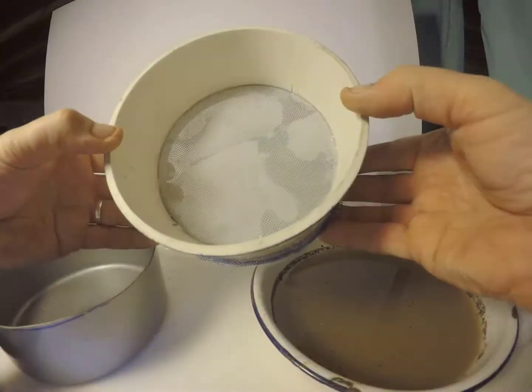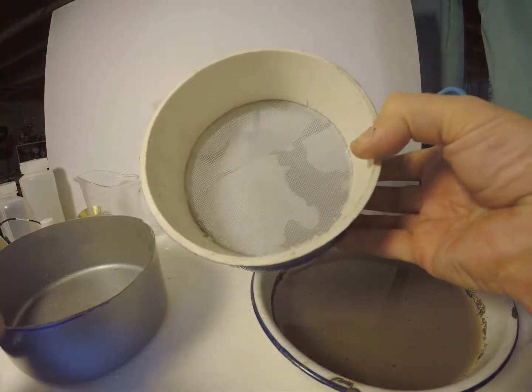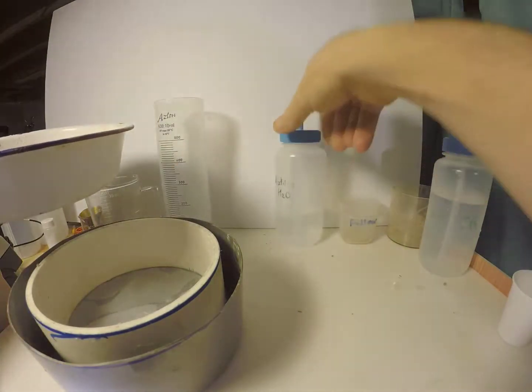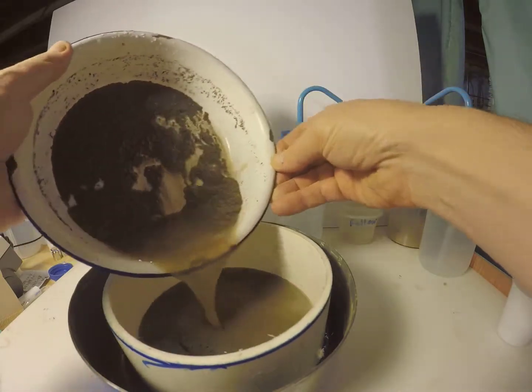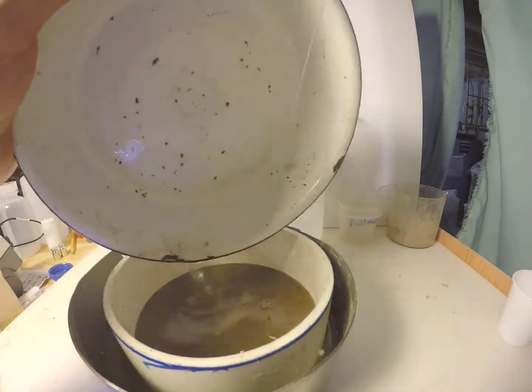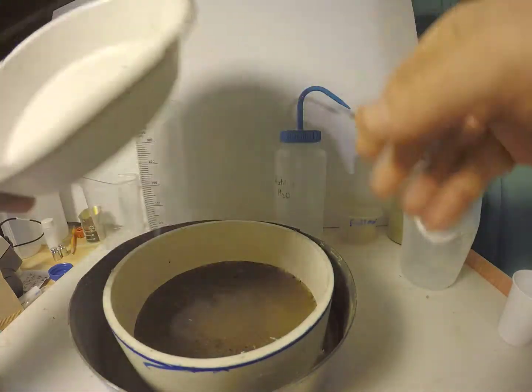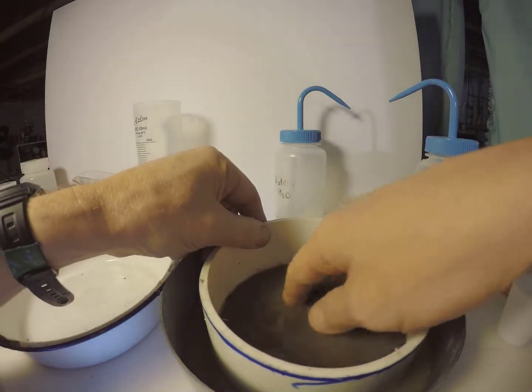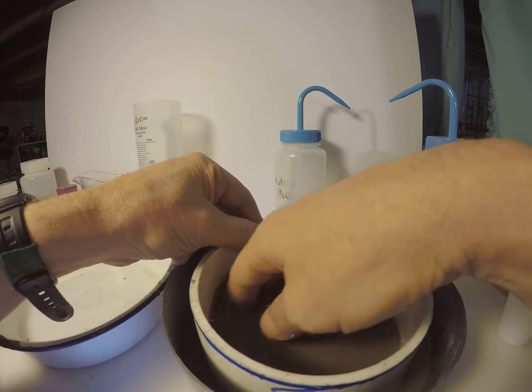Then the soil and organic matter that passed the 2 mm sieve is poured through a 250 micron sieve — in this case one that has been made from silkscreen fabric and a large tube. The 250 micron fraction is sieved in the water. This should be aggressive enough to break down any small aggregates, but retain particles of organic matter.